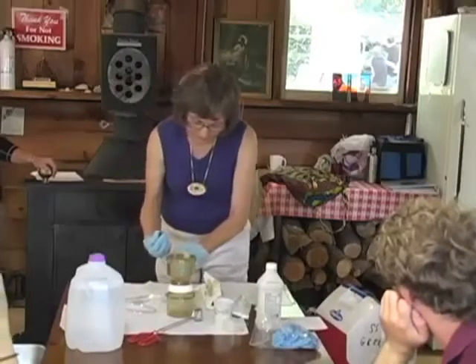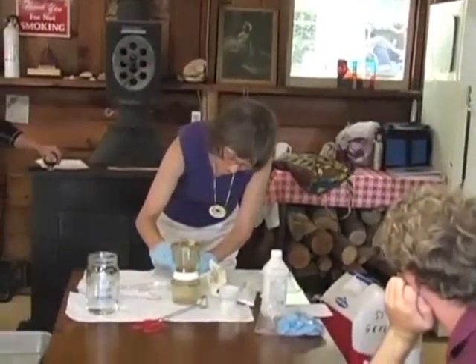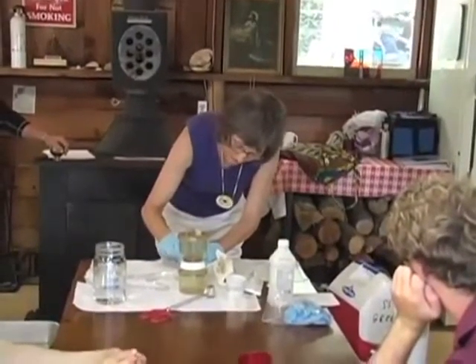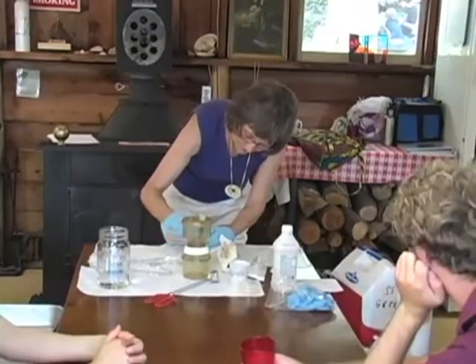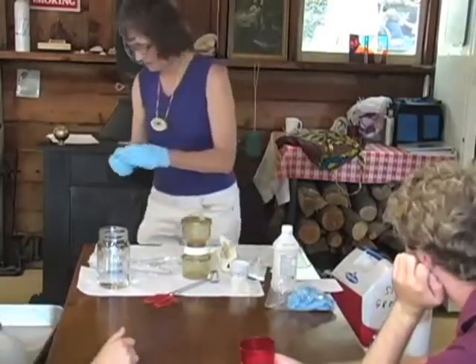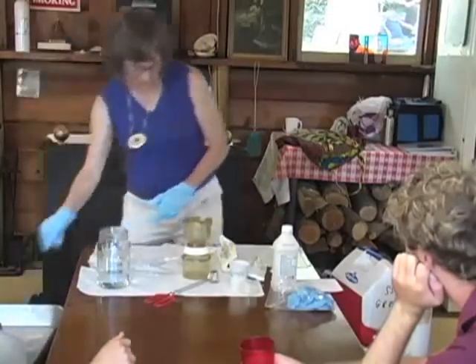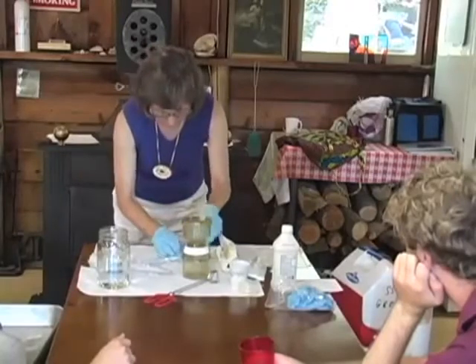Okay, so there is a little pad in here and it's sterile. You can stand up in the back if you want to see. She's just wetting the pad with the nutrient next to it. And that has to be refrigerated, so how do you take that out into the field? In a cooler. Yes, you take it with you in a cooler. Well, you might be able to buy it in country.